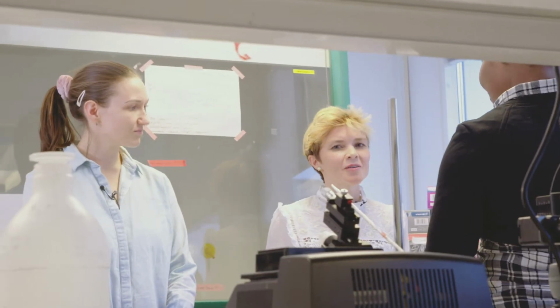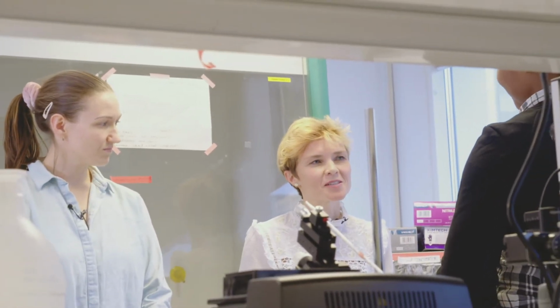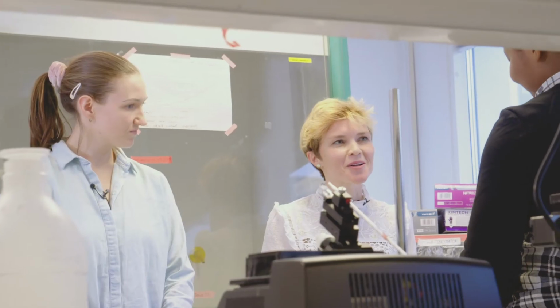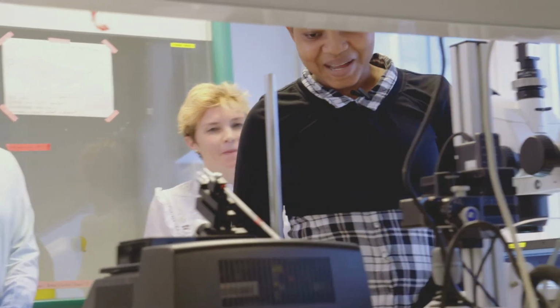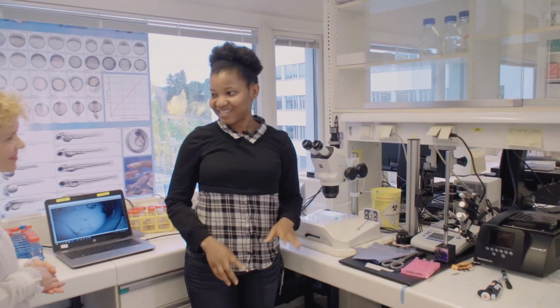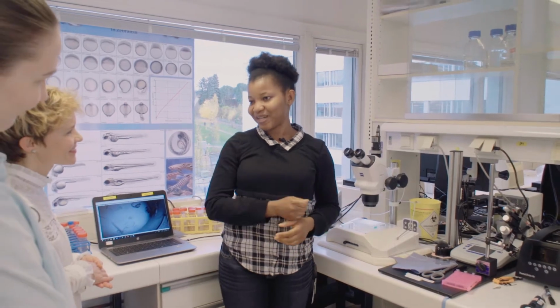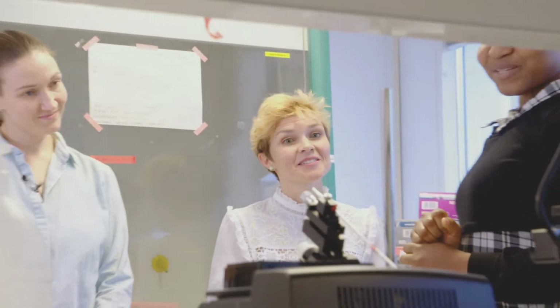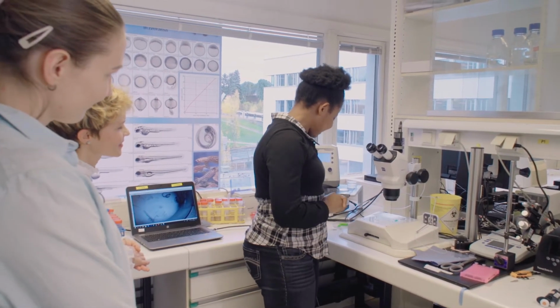So one of the methods that is used a lot, especially with zebrafish, is microinjection, and I know that you use this as well. So can you show us your setup? Yes. So in this lab, we have the micromanipulator set up, but for some reason we feel that we are faster when we do it by hand. Wow. So I will demonstrate to you how we do the injections.